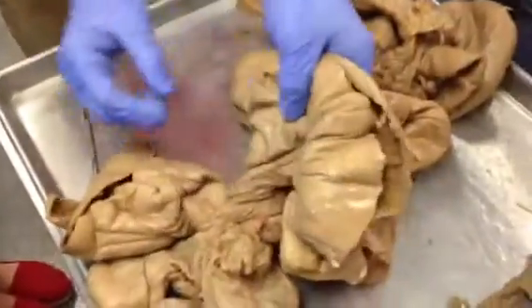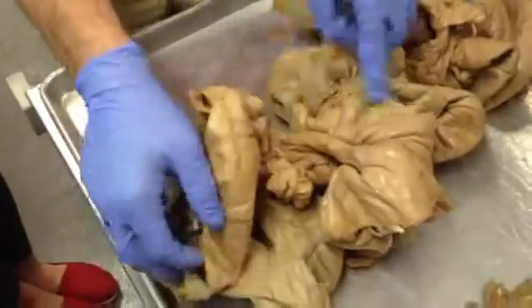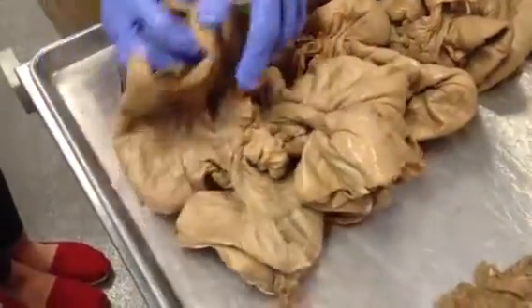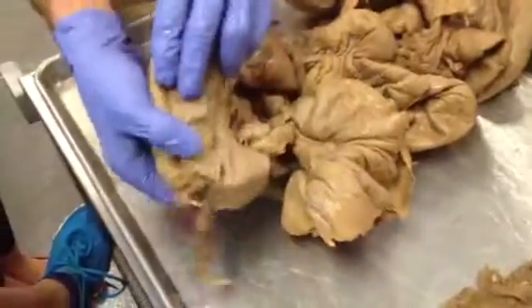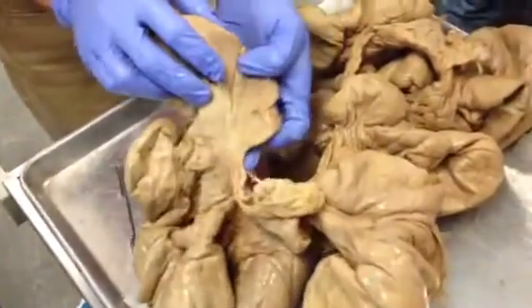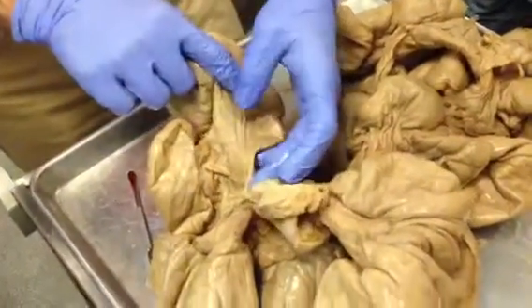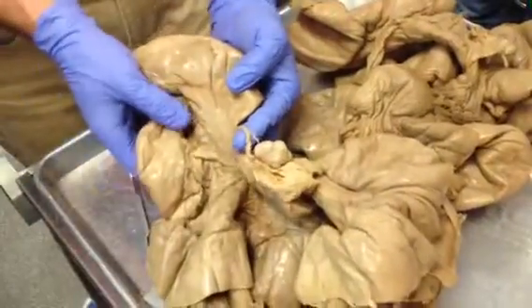This is uterus. So if we kept following this uterus, what ultimately should we... Cervix? No, cervix would be back the other way. Oh, we're going up. Going up. Okay. Before the ovaries, I should... The fallopian tubes, you're right. So I'm just kind of following it up. It's a little hard to see, so make sure you're staying tuned. Look at right there. What's going on? See the uterus? What's it turning into? Fallopian tube.